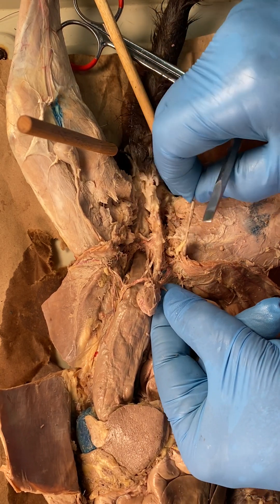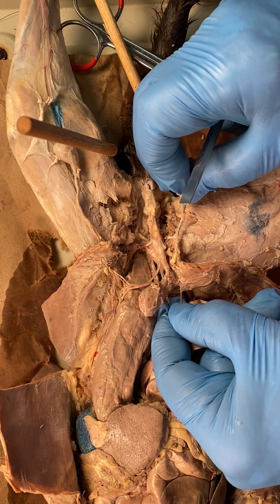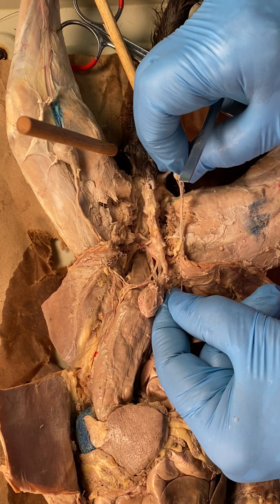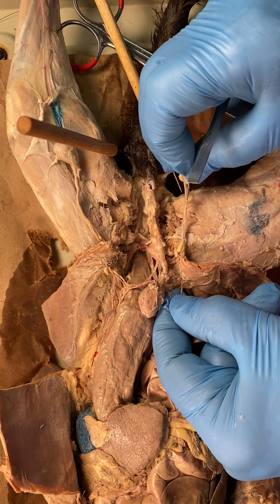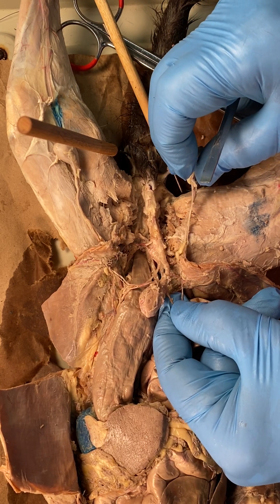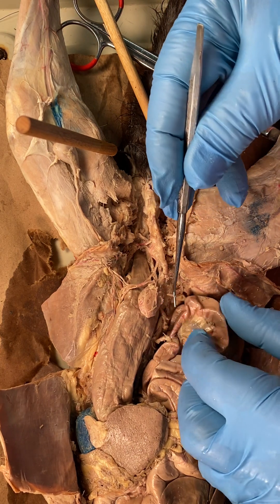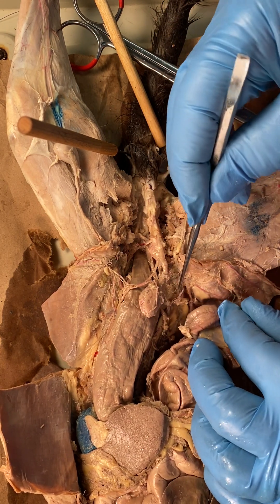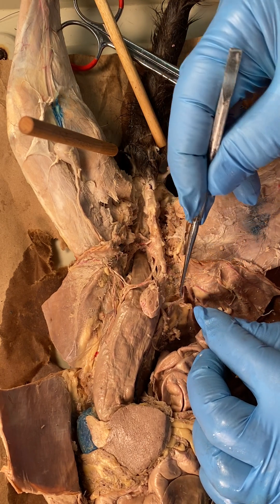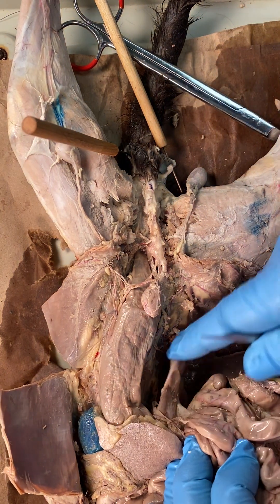I can grab the vas deferens over here, and you can see as I wiggle this back and forth — that's the vas deferens. The vas deferens, also called the ductus deferens in some books — in medicine we like to refer to it as the vas. That's the right vas deferens. The blood vessel has joined it right there, so you can see the spermatic artery and spermatic vein with it.